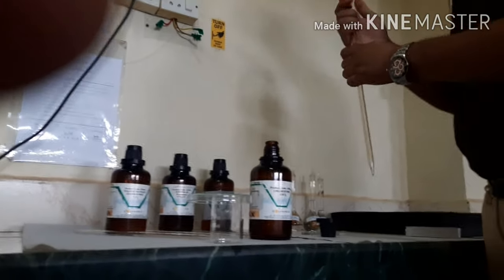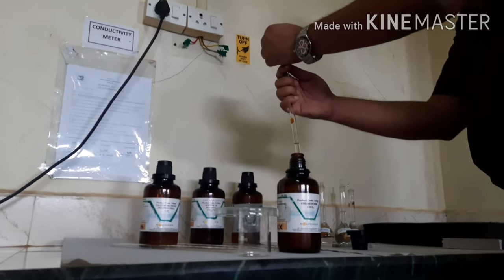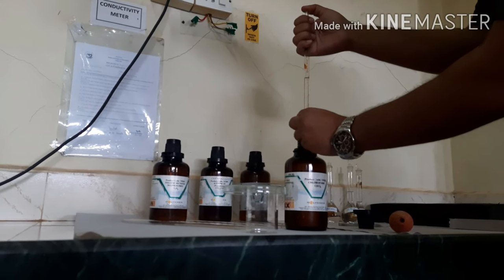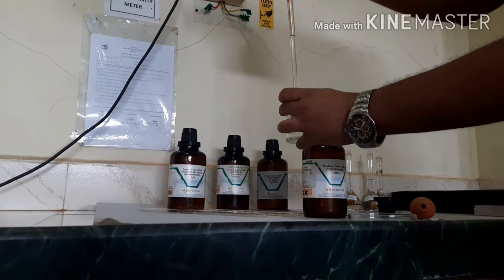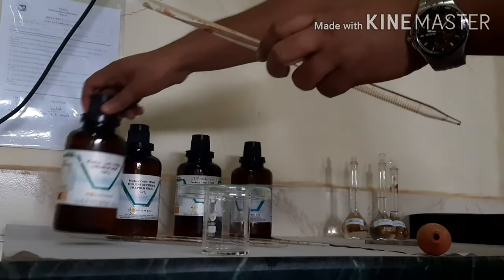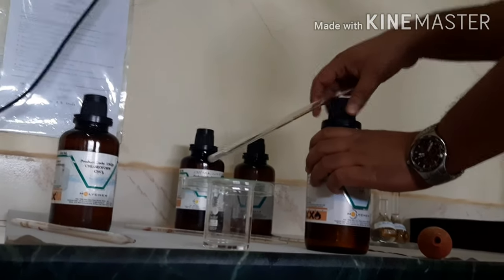We are now preparing the solvent system — the mobile phase. First, we pipette out chloroform. The volume of chloroform required is 6.5 ml. We adjust the pipette level to zero and pipette out 6.5 ml. The lid is then closed immediately since chloroform is volatile. Next is toluene, and the amount required is 1 ml.